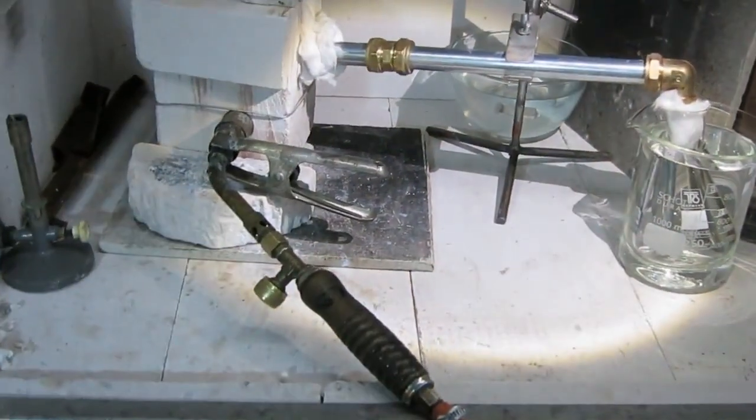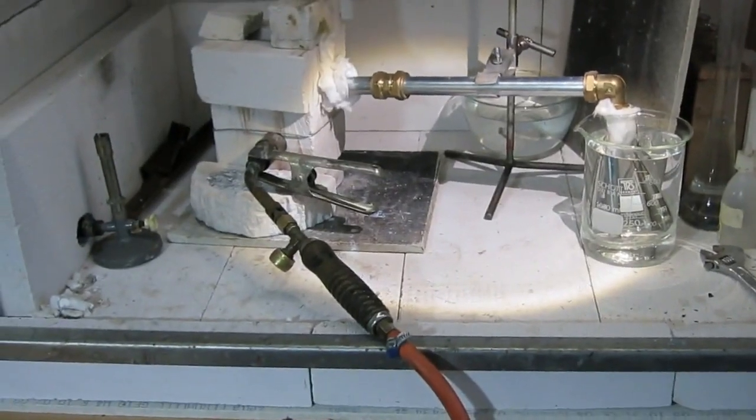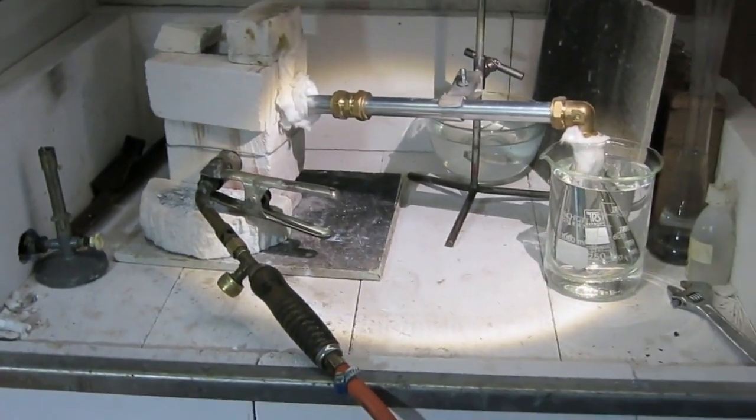So this is the setup, and now I'm going to turn on the burner and the fume hood and see what happens.